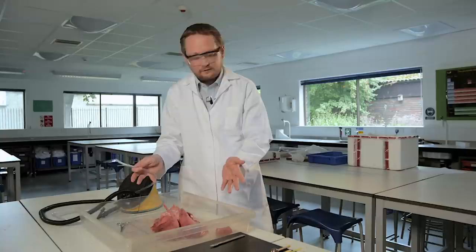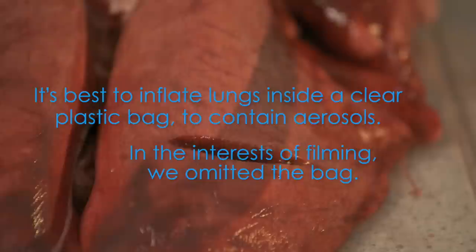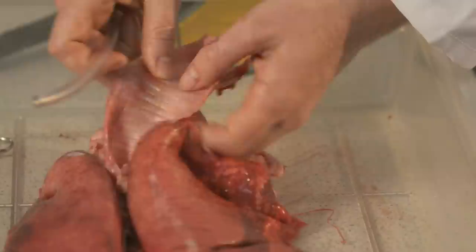It can be a good idea to do the inflation in a plastic bag. You want the students to be able to see what's going on but you don't want aerosols traveling to the students. The lungs that you will get will have slashes on them. And so the slashed bits are the particular places where you might get aerosol release.